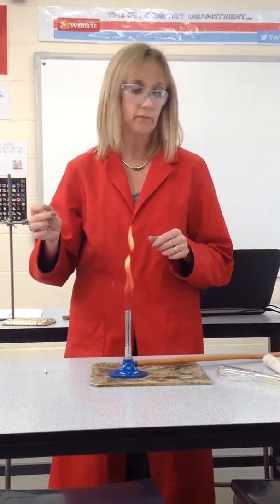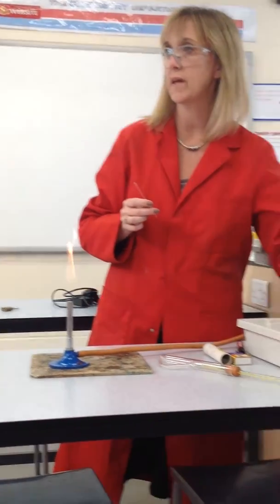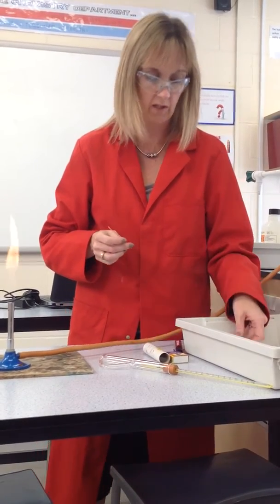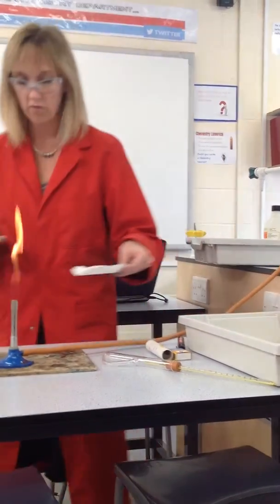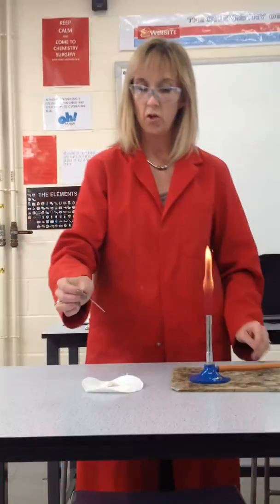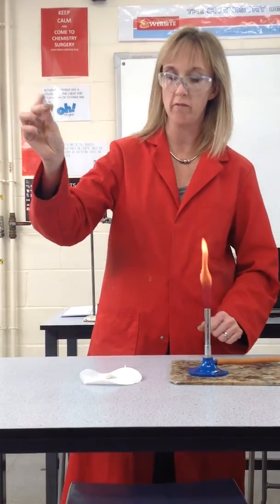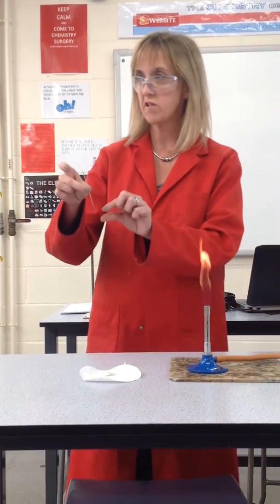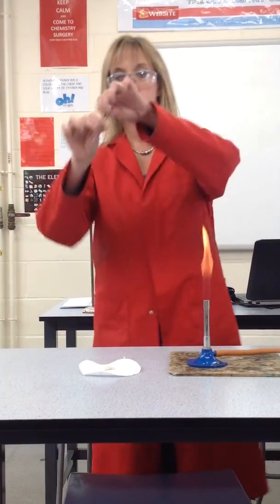Because we're going to work out your percentage yields, I don't want to use any of your crystals, so I'm just kind of pretending a little bit. What you would do is get the crystals, then get the open end of your capillary tube and tap it into the crystals to get a few crystals into the capillary tube.